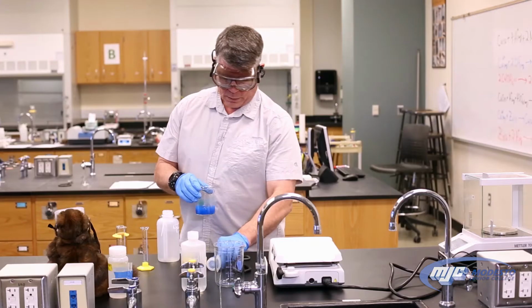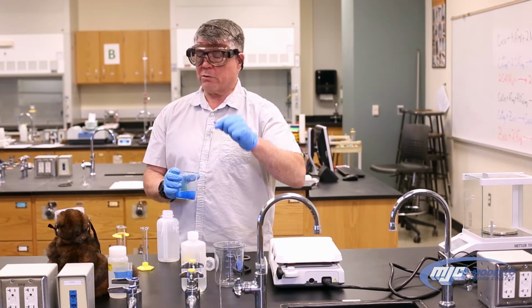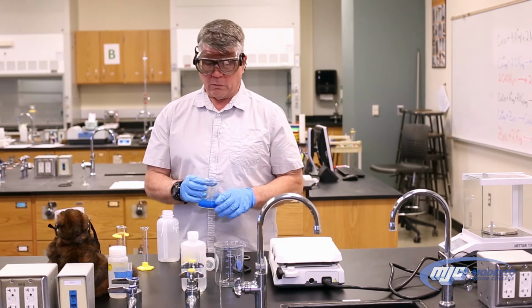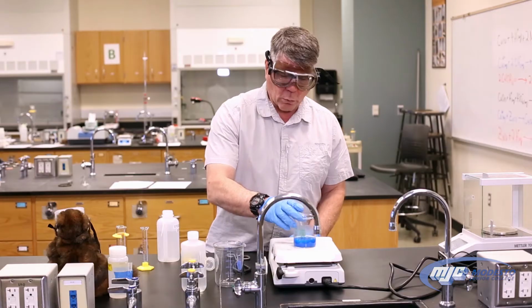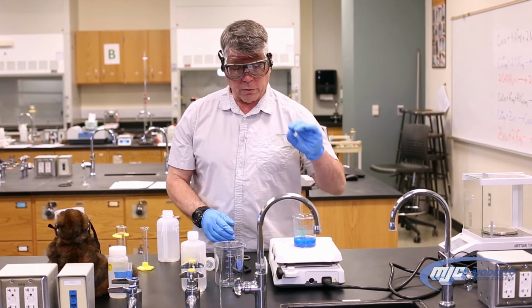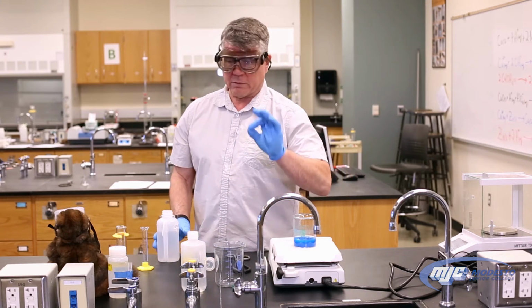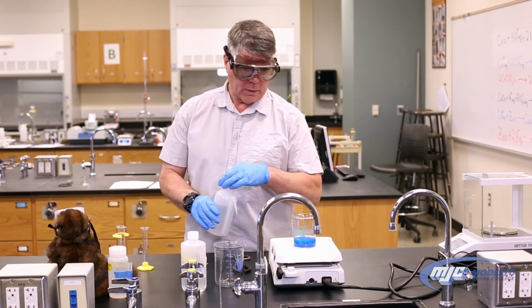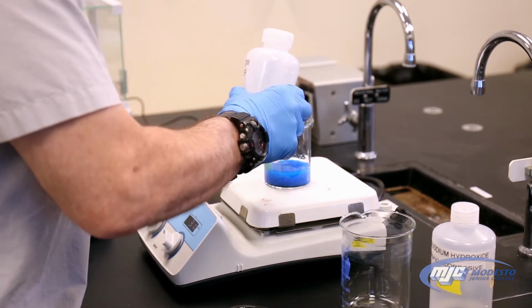Put it on. I'm going to take my magnetic stir bar because like in the gravimetric analysis lab, if we don't continuously stir this, it will bump and it shoots everywhere. So we're looking, guys, for the same thing that we did in gravimetric analysis. We're looking for this bright blue color to turn all dark brown. That's the copper 2 oxide from the copper 2 hydroxide. We also want to make sure that we rinse down the sides, get all that copper in solution.